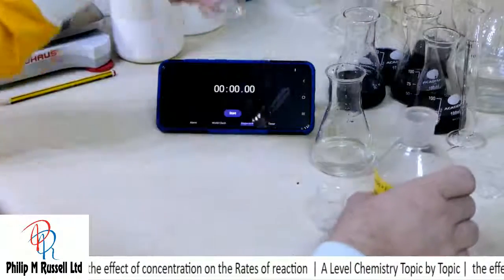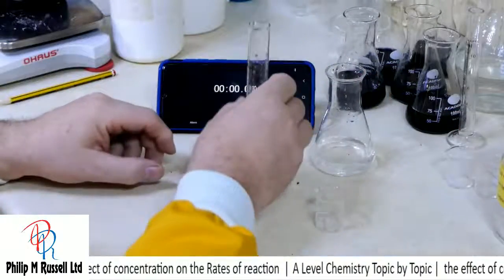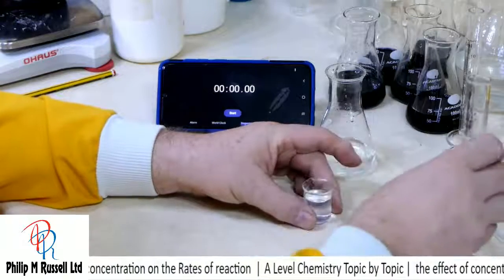So as long as we do this within a sort of a week, and here I've actually made them up more accurately straight away, so I know this is going to work.